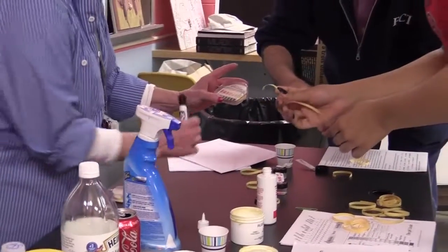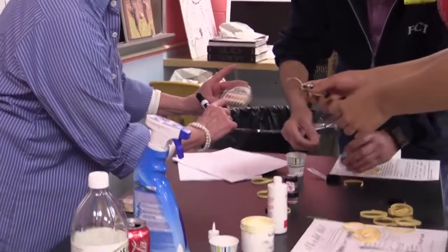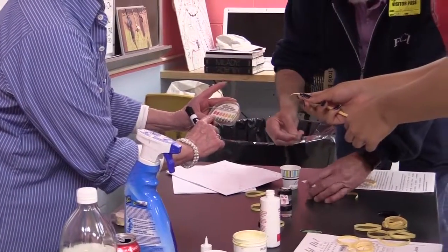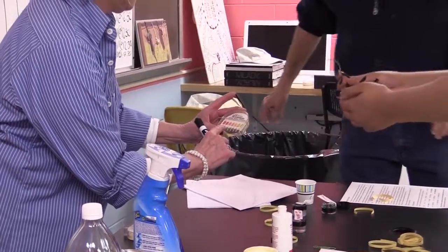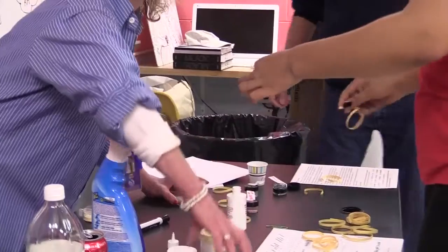That's definitely right about, I would say, around a 9 or an 8. No, it's getting darker. I would go with a 9. So this hair relaxer is definitely a 9.